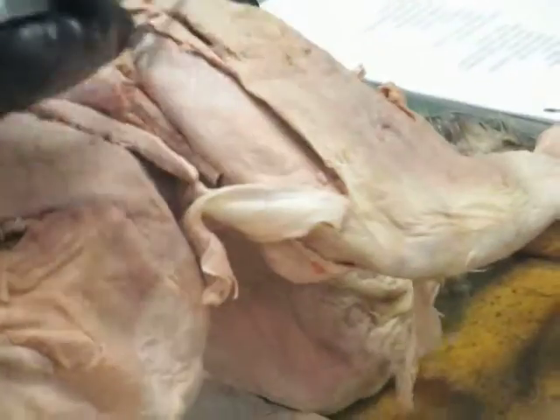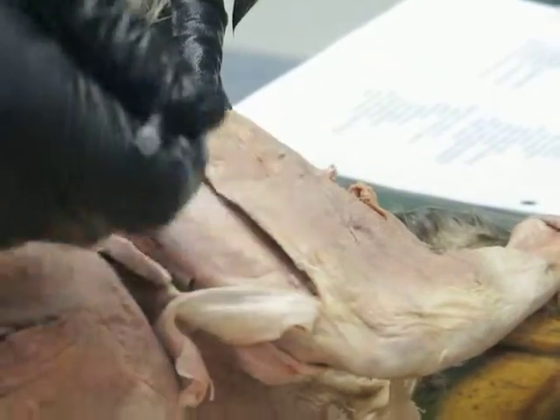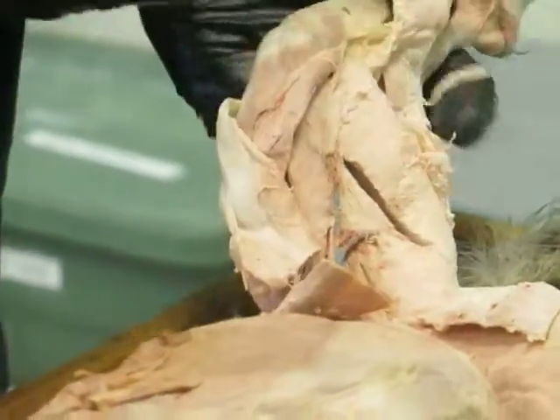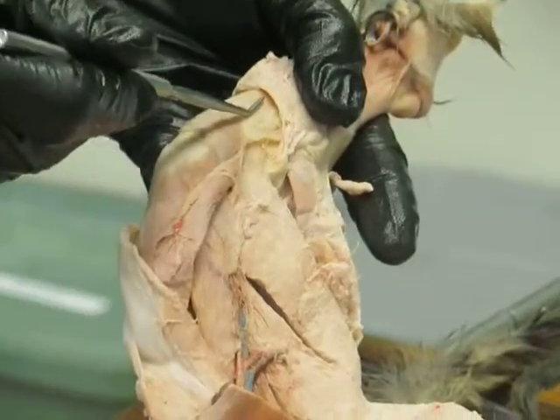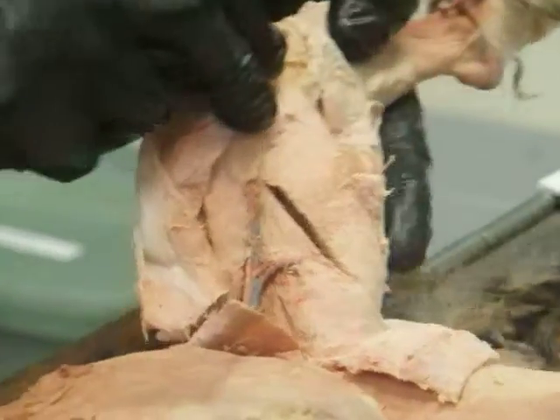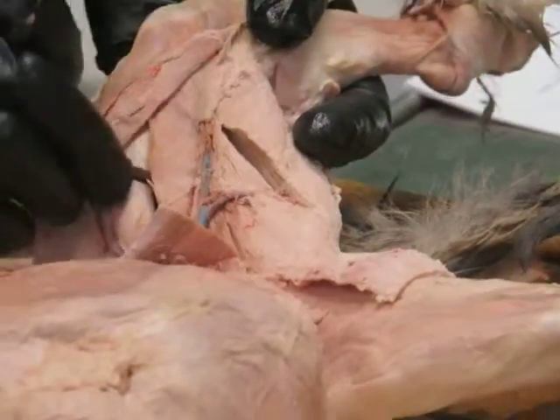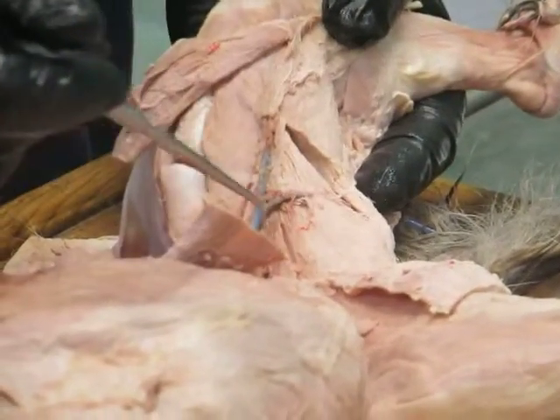The biceps femoris is the one of the three that's lateral, where it attaches into the shank. The semitendinosus and semimembranosus are medial, where they come into the shank. Okay. So we're just kind of going down these and eliminating things. There's quadriceps, there's hamstrings. That leaves us this group of muscles kind of in here.